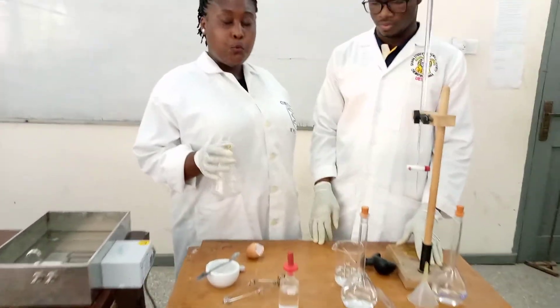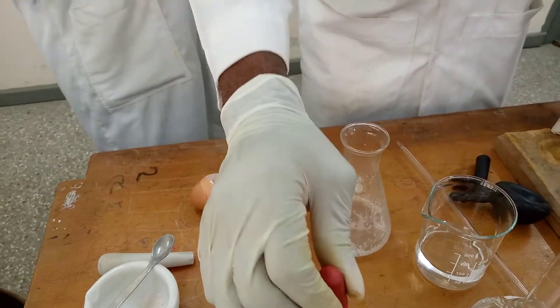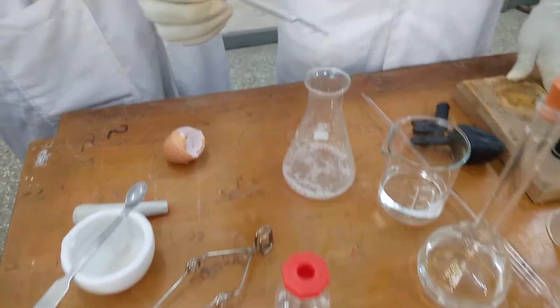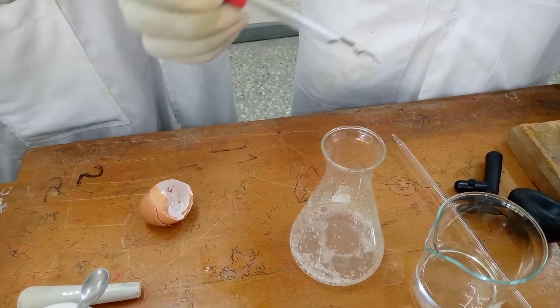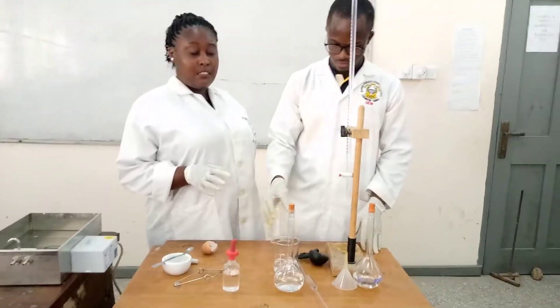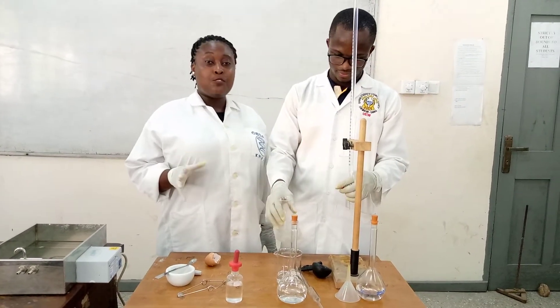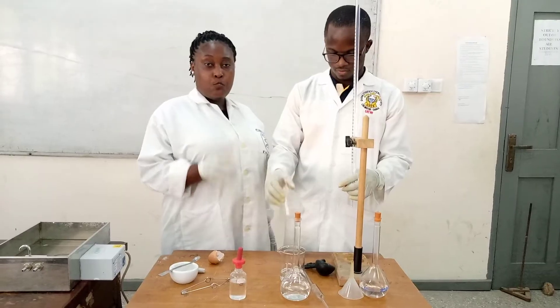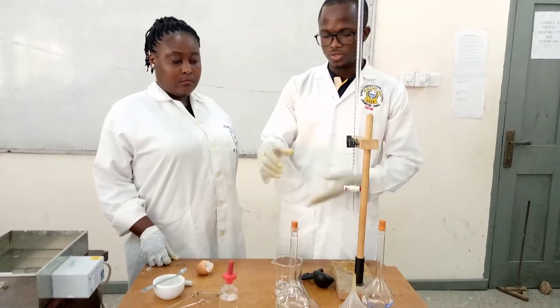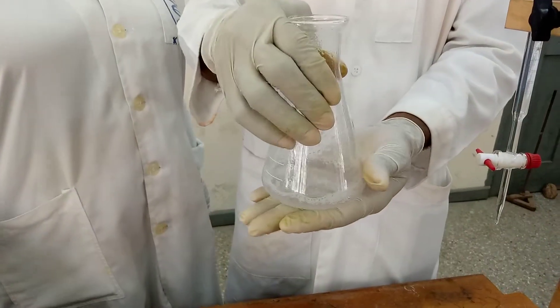We have allowed it to cool, and now I is going to add 3 drops of phenolphthalein indicator to it. We are going to titrate it against 1 molar sodium hydroxide. Because HCl is a strong acid, we need a strong base to titrate it, so we are using sodium hydroxide. After adding phenolphthalein, our resulting mixture is still colorless — now let's titrate it to see our end point.